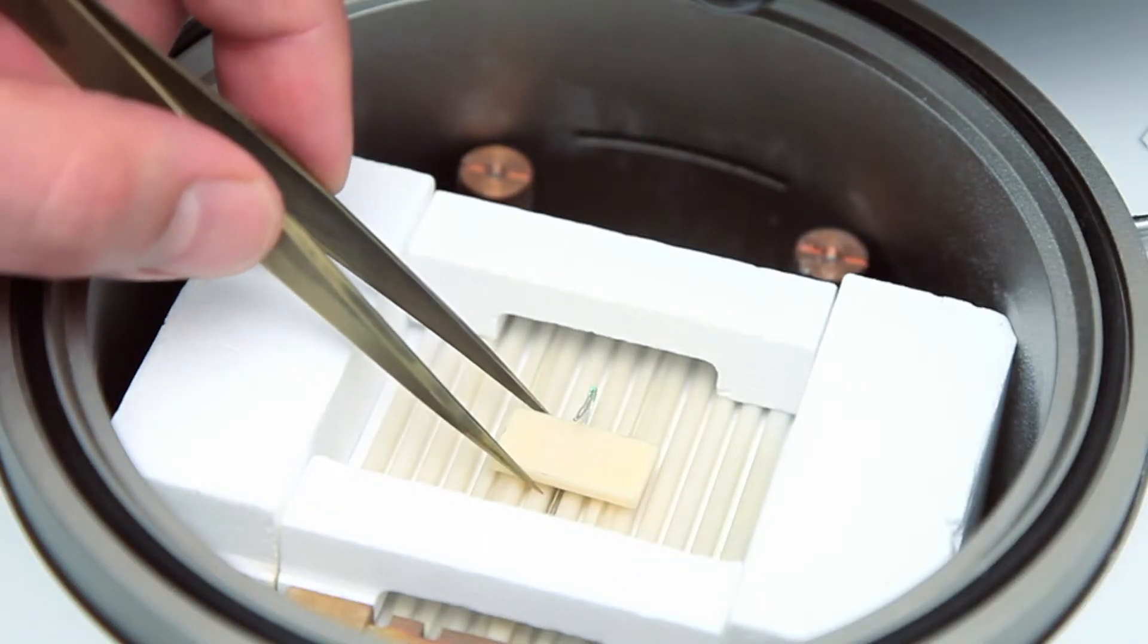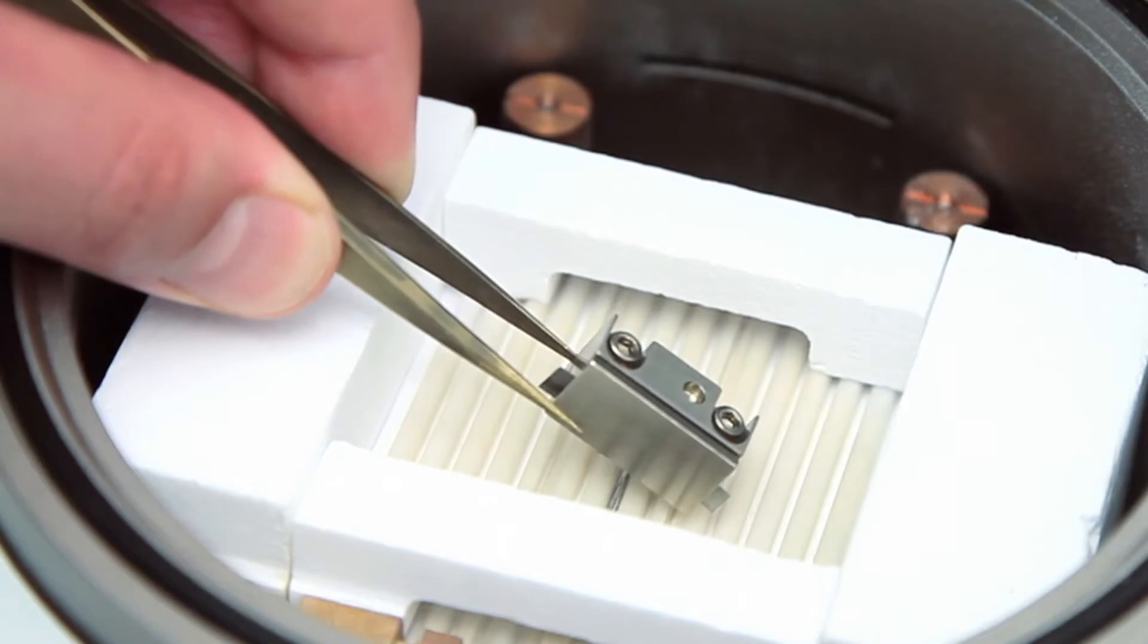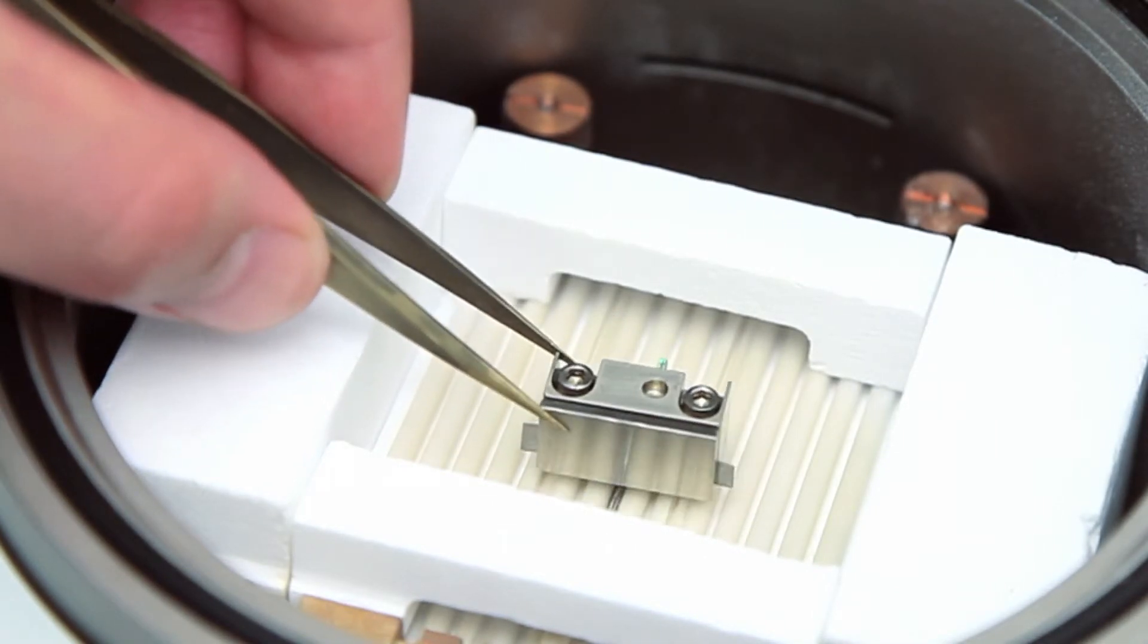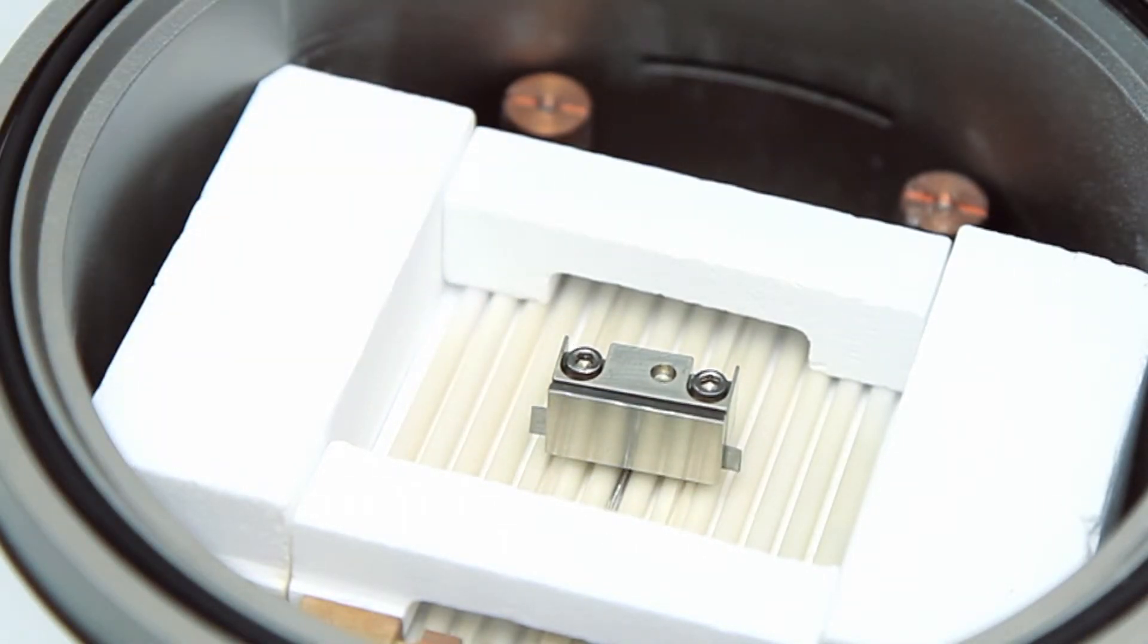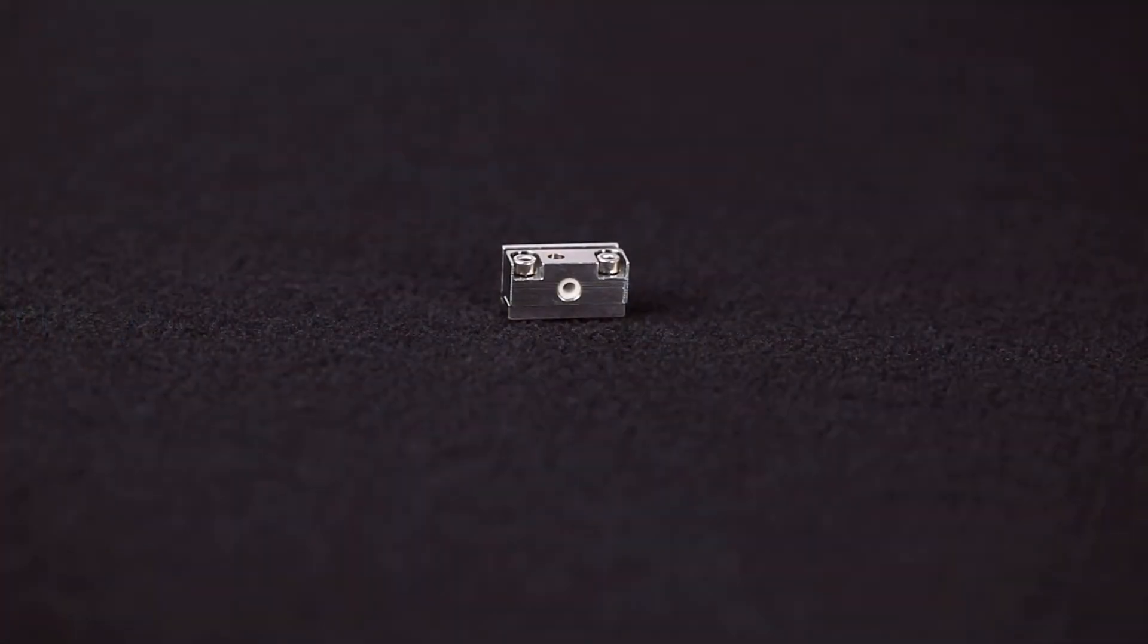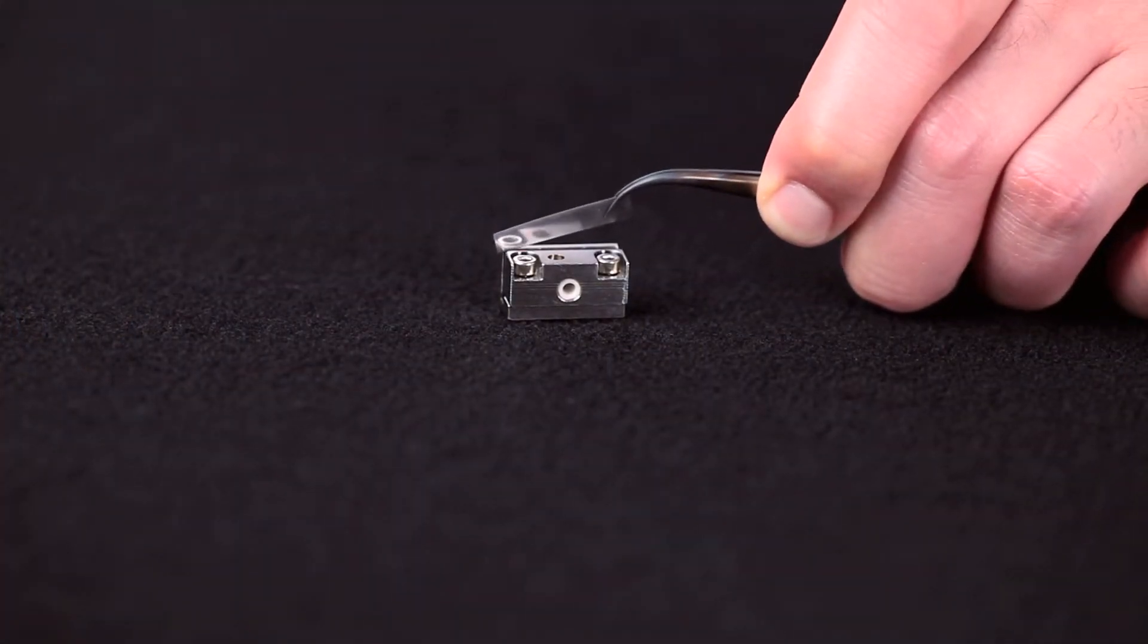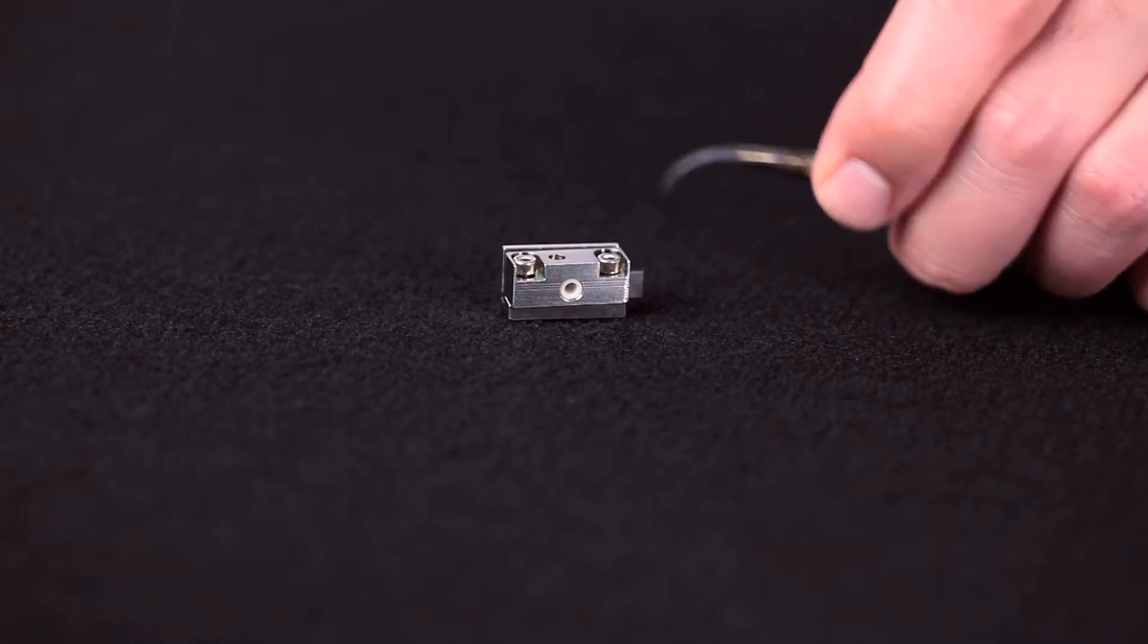You need to remove the sample holder and place the thin film holder on the rods. The thin film holder is 21 millimeters long and 11 millimeters wide. To be able to see by the CCD detector, the sample needs to be longer than 21 millimeters.